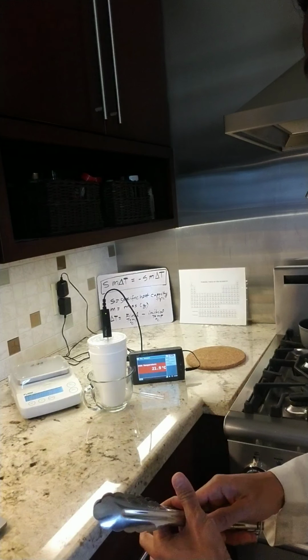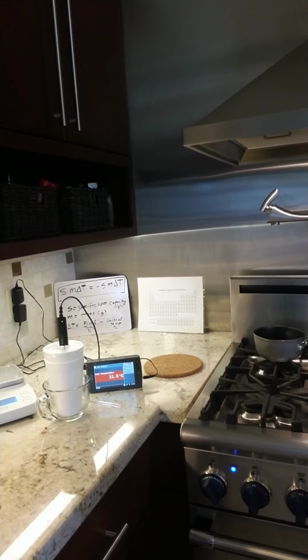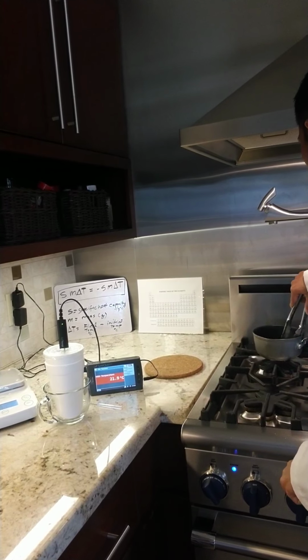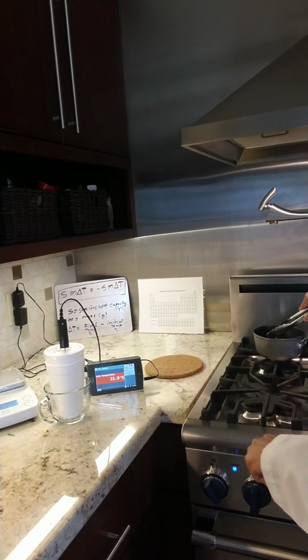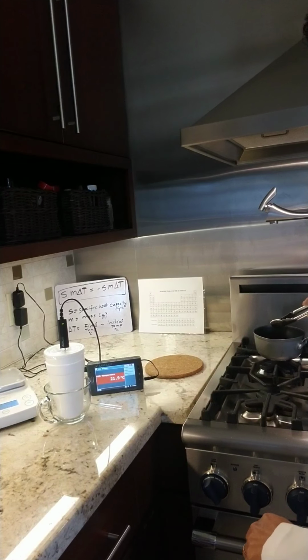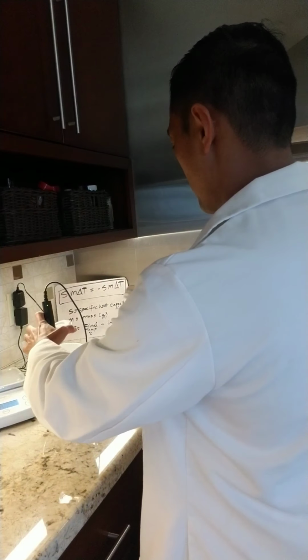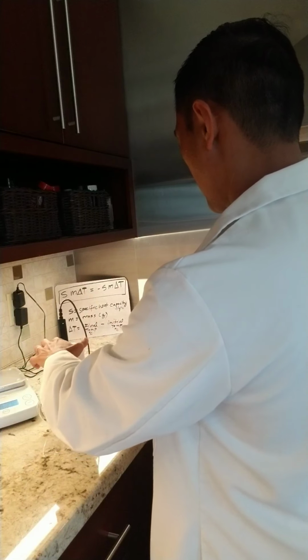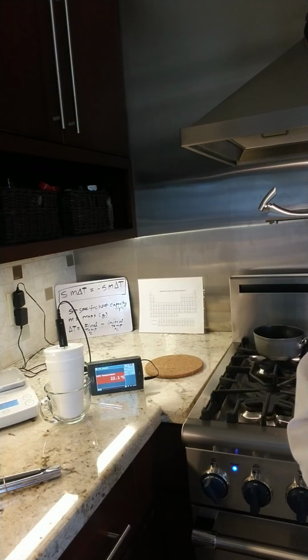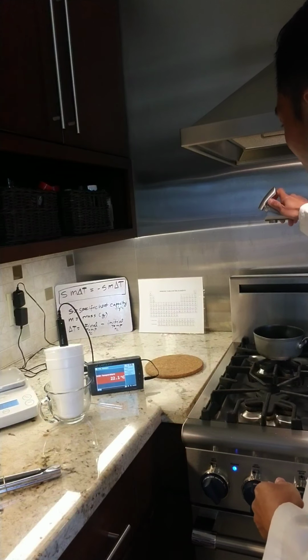So I'm going to move our first metal from our, I don't know if you can see it, but let me show you. Right there, so we can get everything in the picture. Okay, here's your first metal. And in a way, I don't want you to see the metal. We'll weigh the metal and describe it later on. But here is our first one. Okay, so I added it in there. What we'll do is wait about 30 seconds each time. I'm going to add a little bit more water for the second metal here.